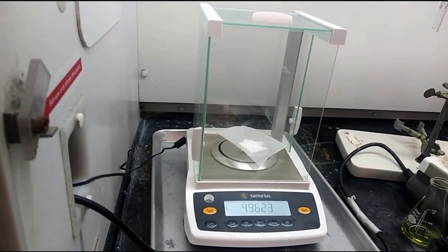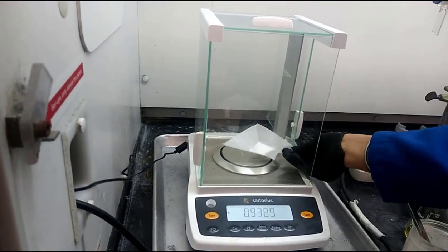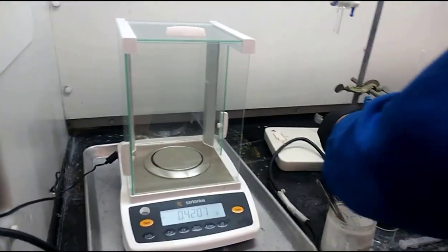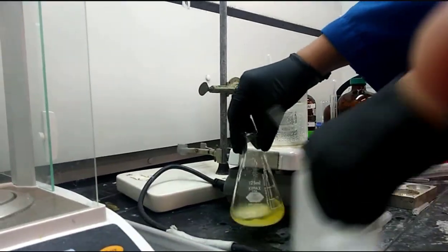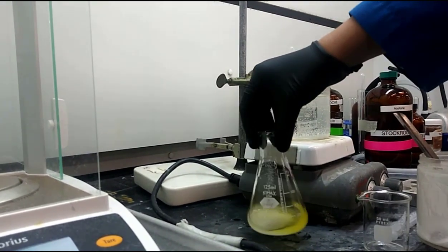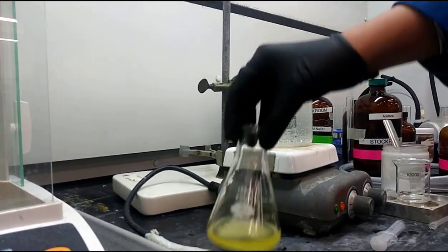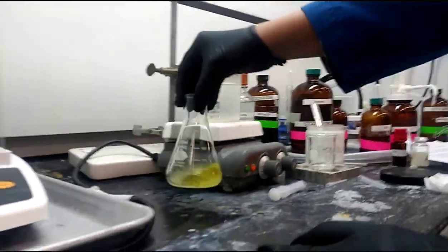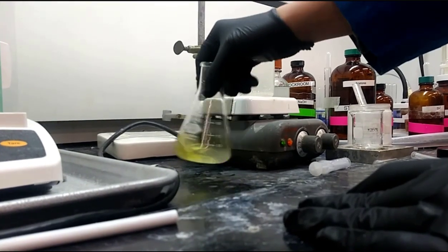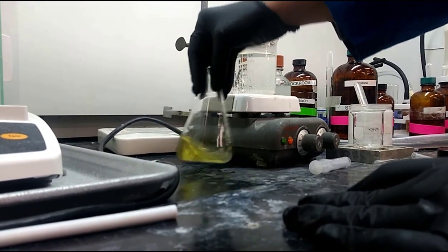boron. And so that's why adding the base, sodium hydroxide, and the hydrogen peroxide are important here, because now they do have alcohol, like hexanol, 1-hexanol in that solution. Being an alcohol, it can hydrogen bond, so it does have some solubility in water, but since it also has a 6-carbon chain, it's also quite soluble in an organic layer. So by adding the potassium carbonate, they salt the aqueous layer, making it highly ionic, and that makes the alcohol less soluble in water.